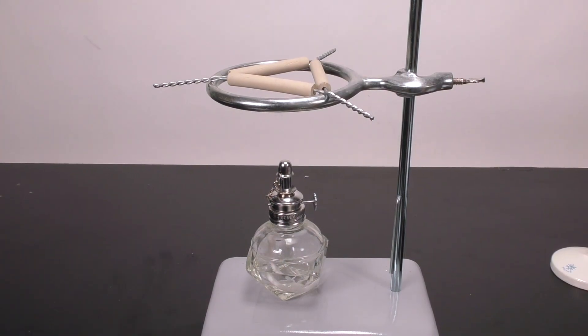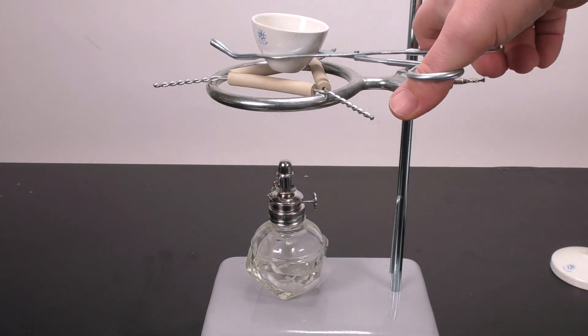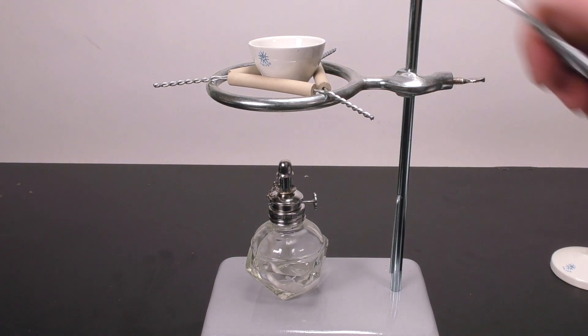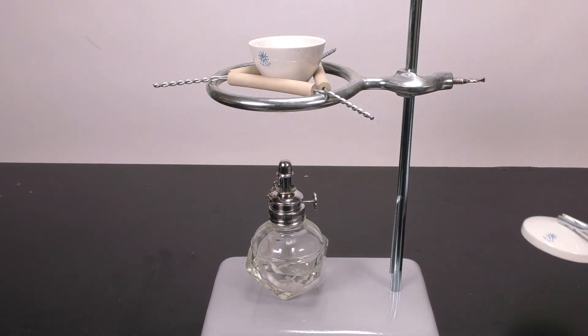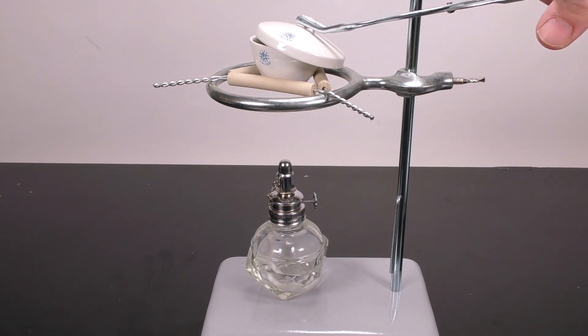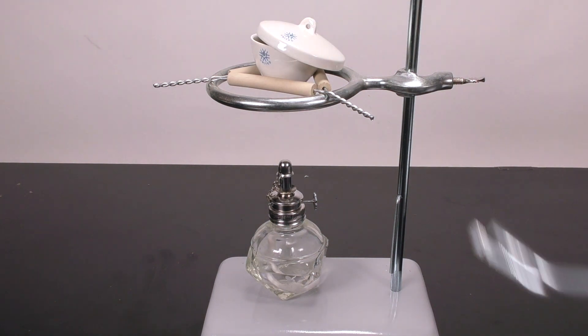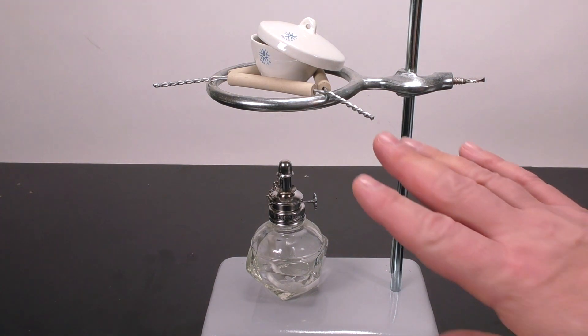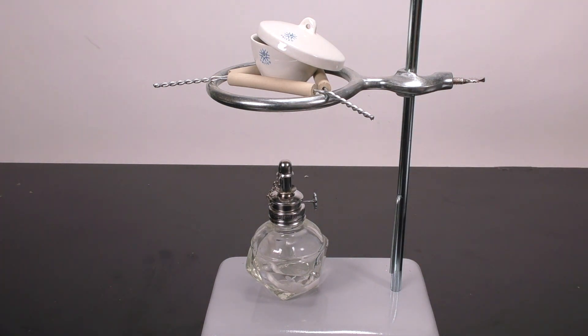Since you will be heating things up, it's important to have any unwanted moisture removed. So if you have just washed your crucible, you want to place it onto the triangle and then leave the lid slightly ajar so moisture and gases can escape. Run this for about 30 seconds so that it's completely dried out.